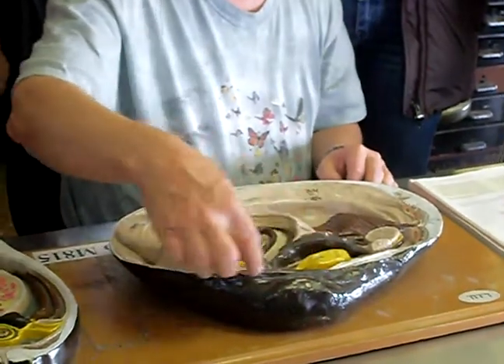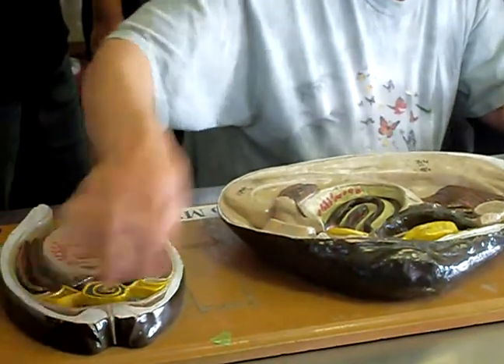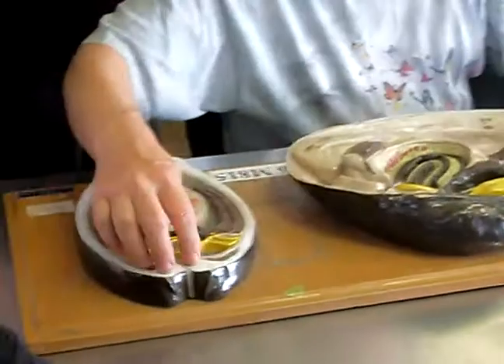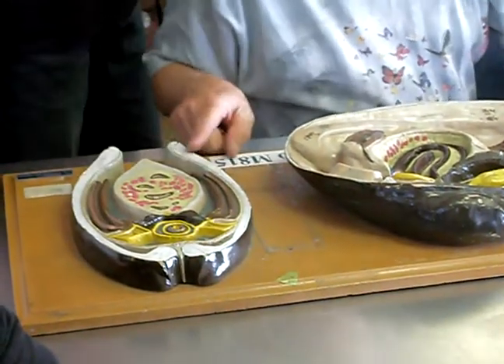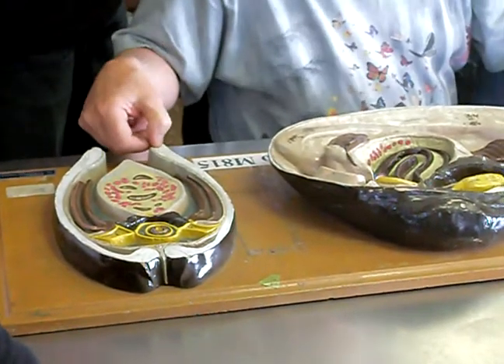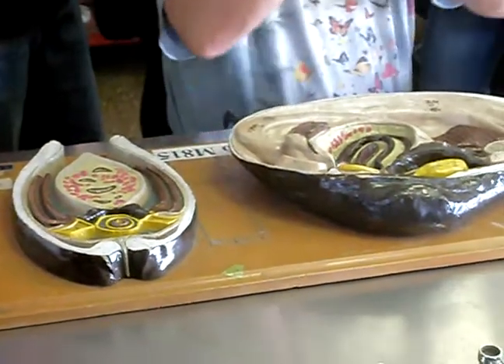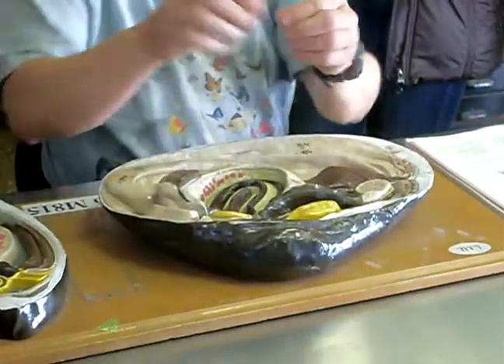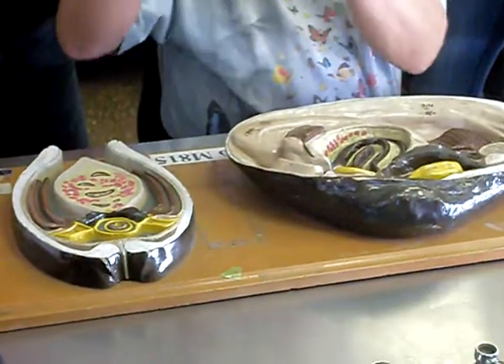This is the upper part of the shell where they're attached together — this is called the hinge. The umbo is this dorsal portion of the shell, the oldest part of the shell. The way they grow, this part up here is the oldest. As they get older, they add more and more — they keep getting longer. You can see all these growth lines where new shell has been added. This is older, this is younger, and this is younger than this, and so on. When the clam starts out, it's just a little clam. The umbo up here is the oldest part of the shell, and as it's grown, it's grown in this direction and gotten bigger and bigger.